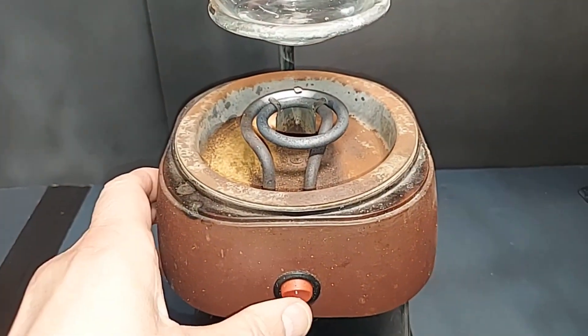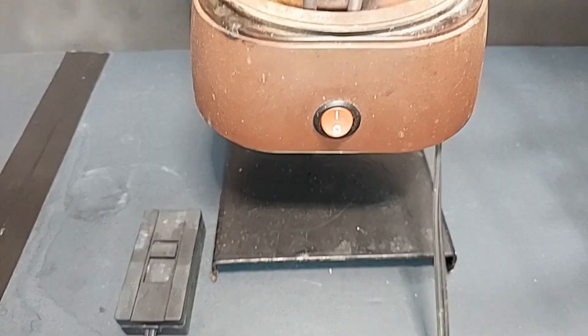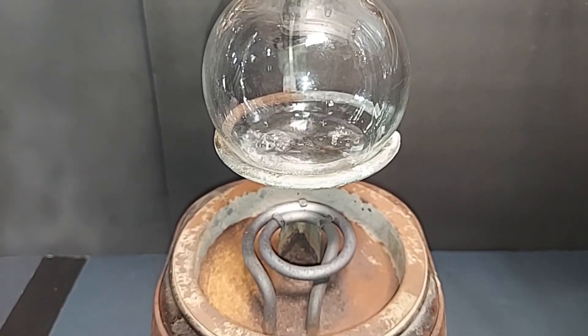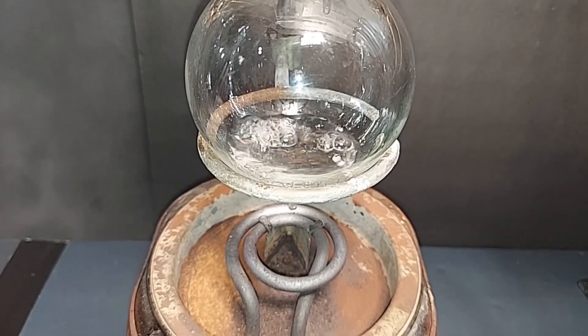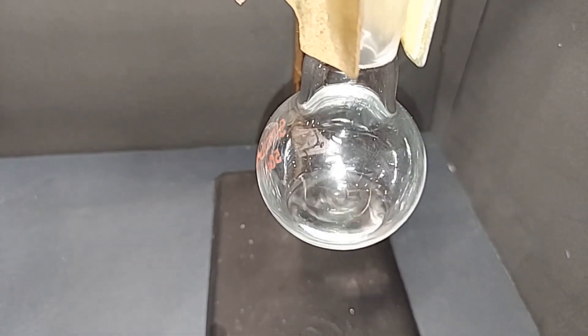So it's that time. Let's go ahead and turn this on. And I will be back when something actually starts to happen. We do have the temperature pretty low. In fact, those rings aren't even glowing. But we do have some nice boiling going on. The temperature is getting up there. If you can see, it's around 60 degrees, but it's raising and we'll top off right around 75 to 78. It's a little variable, but it'll get there. The temperature has reached 76 degrees and we have a really nice boil going on. And on this end, it's dripping really well. This will be our purified ethyl acetate.